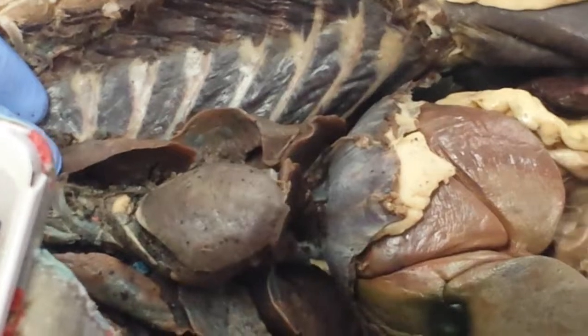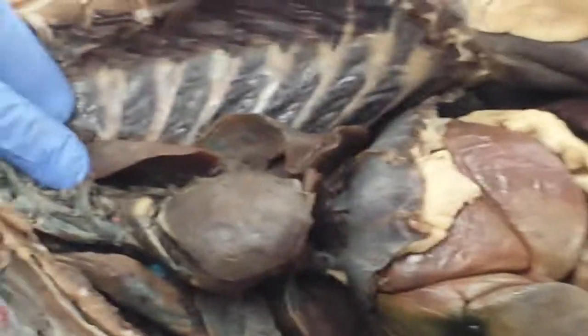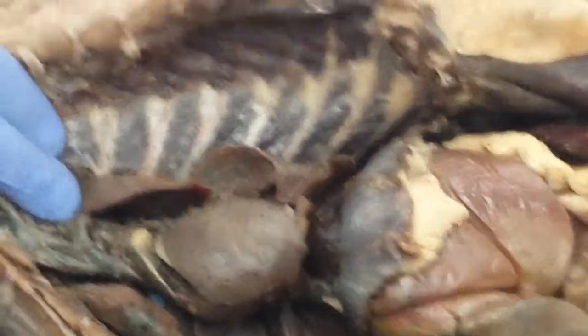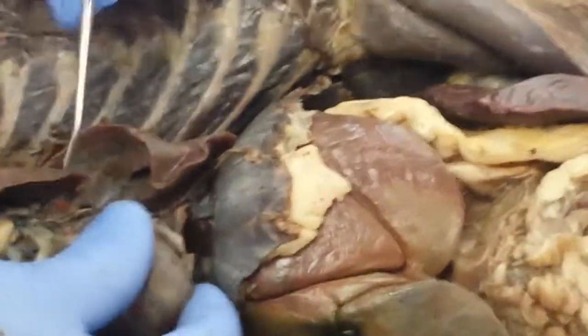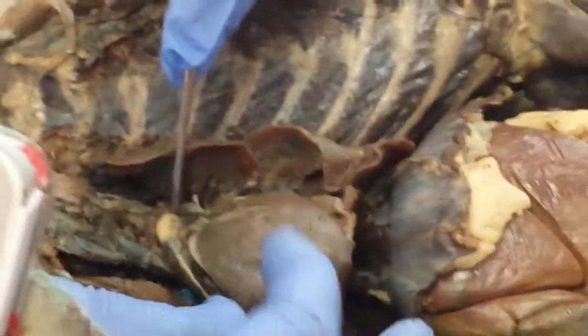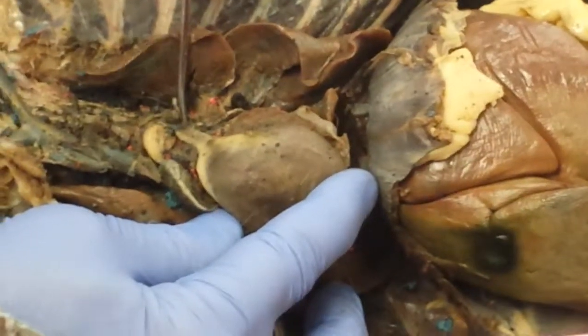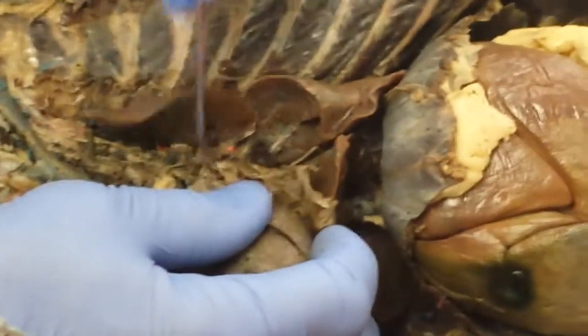We define arteries and veins how? By the blood flow. Veins bring blood back to the heart. Arteries take blood away from the heart. It has nothing to do with oxygen levels. So that's why we call this the pulmonary trunk or pulmonary artery. Very inconspicuous here, the most anterior structure coming out of the right ventricle right here. Pulmonary trunk. See that? You're not going to see it very well.